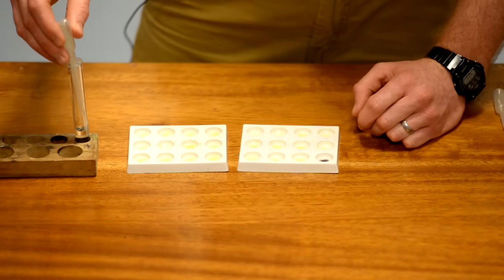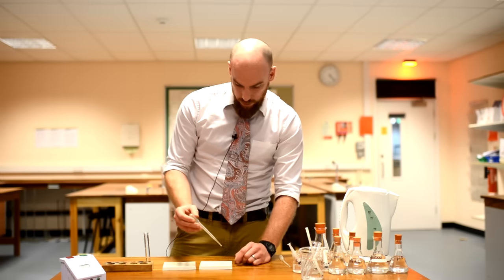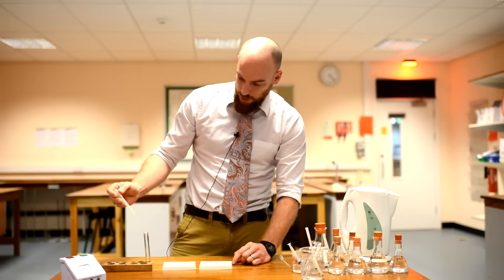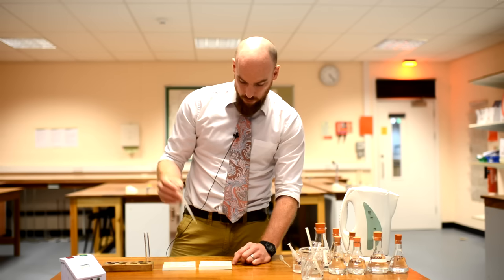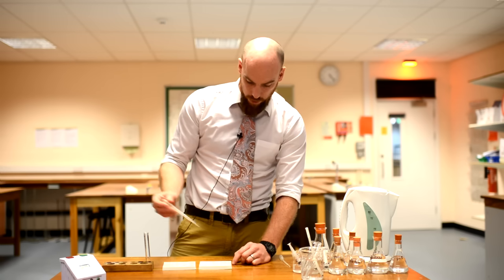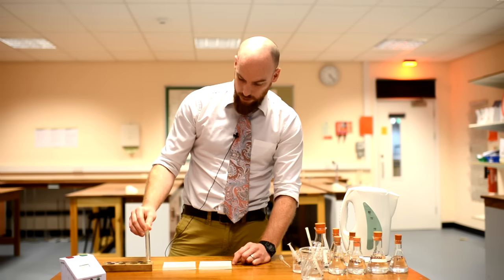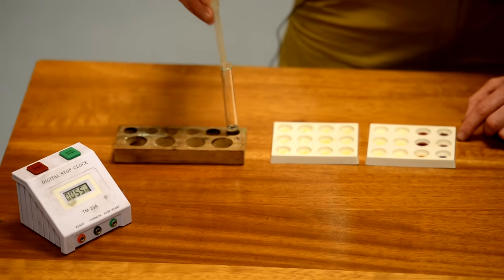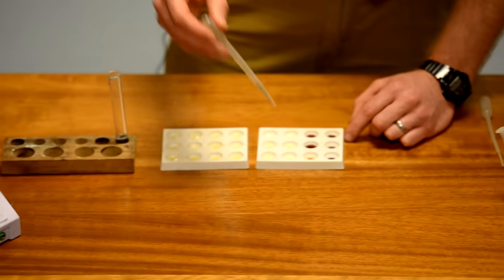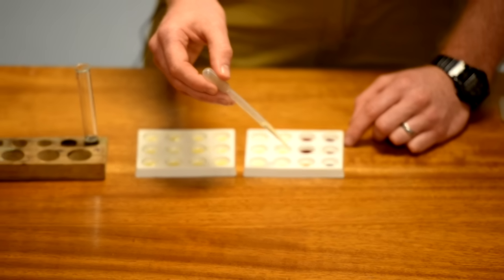Then every 10 seconds on your timer you need to repeat the process until you no longer get a positive test for starch. The enzyme has digested the starch into sugar solution.